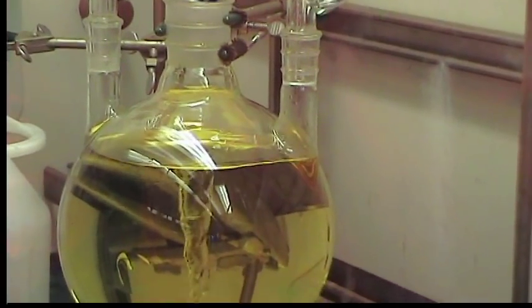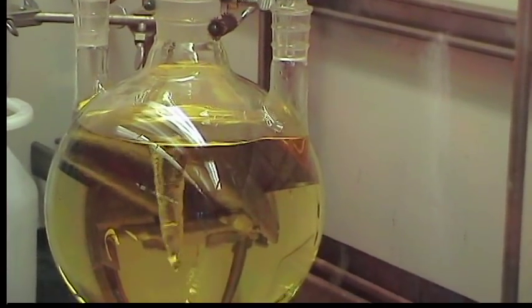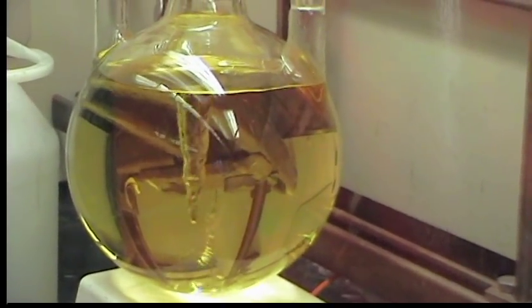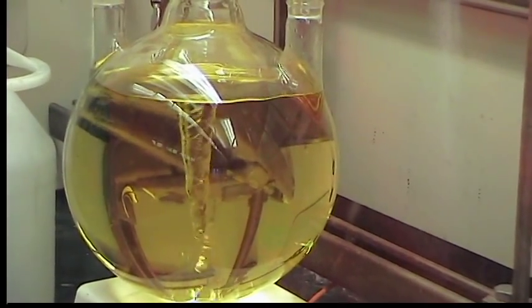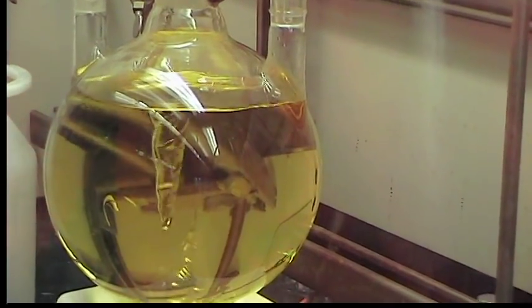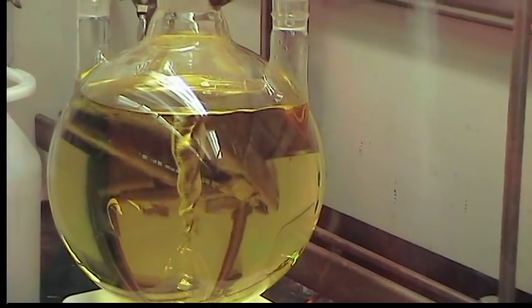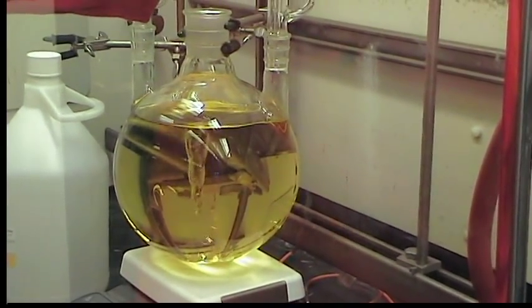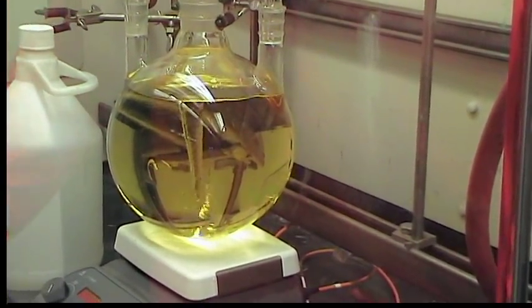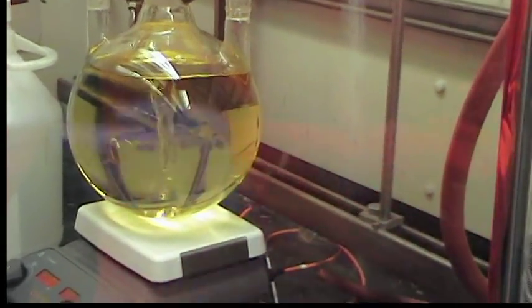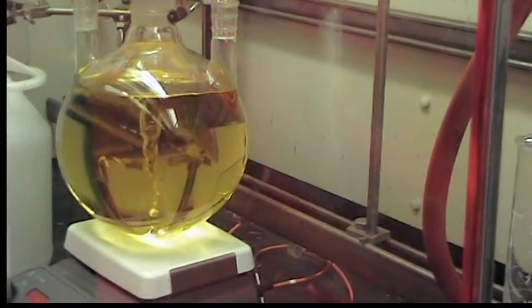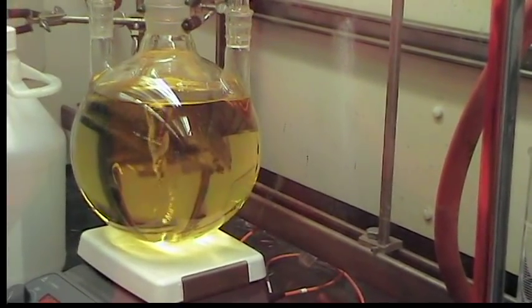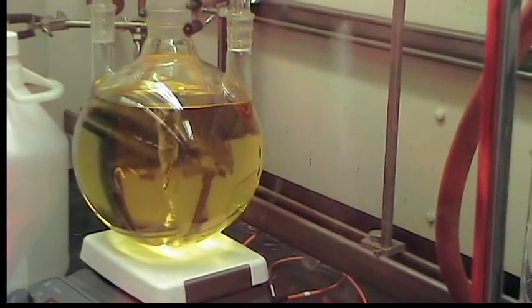Eventually the temperature of the mixture will reach 90 degrees, at which point this temperature is necessary for the reaction to occur to completion. We're going to let this slow dropwise addition continue and try to regulate it so it's being added over about 2 hours. The color is going to darken to some brown and eventually some solids are going to form.